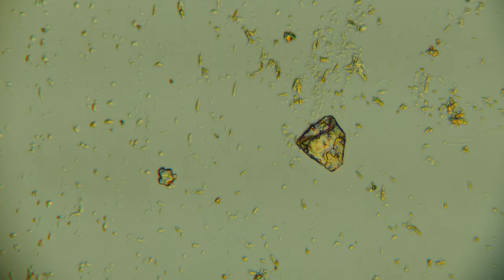Okay, yeah, now I'm back with my glasses. Basically, the objectives say, I don't know what the NA is on it, but they say it's an S Plan 40, 0.70, 160, I think, is the tube length diameter, and then 0.17. So it's 0.70, 160, 0.17. All my objectives say that on them.